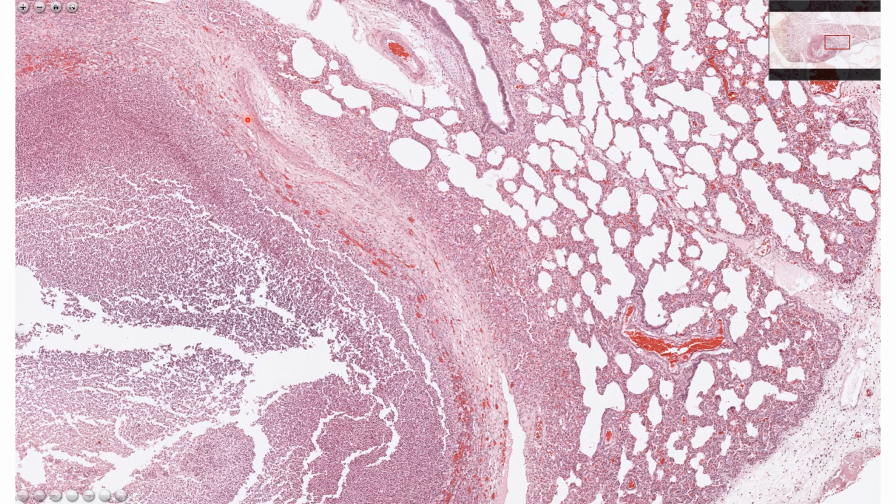It is composed mainly of neutrophils and necrotic cellular and tissue debris. So this is a neutrophilic exudate, right? And it is named pus, or also known as abscess. So this is a feature of lung abscess.